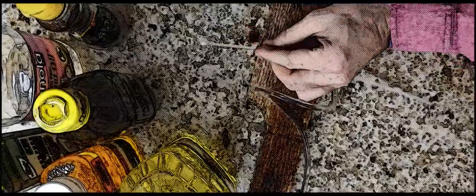It's kind of a mess here, but I had to use rubber bands and duct tape. Once it's all put together, we'll measure the time it takes for the fluid to travel half a meter and use that to calculate viscosity.